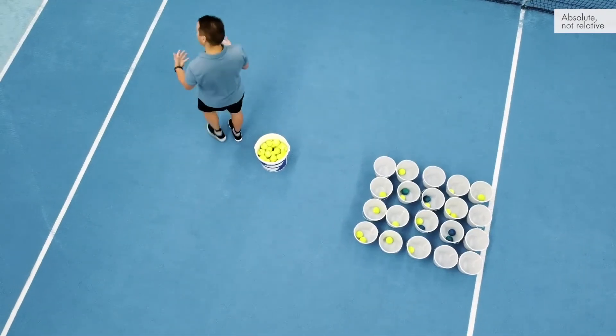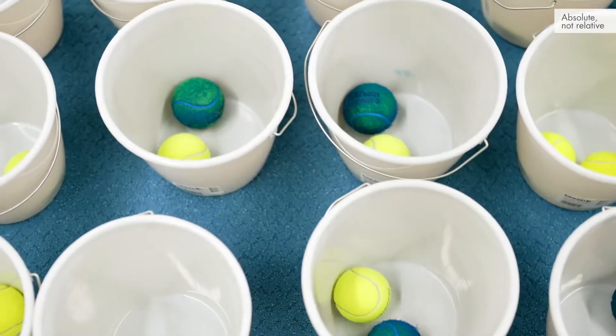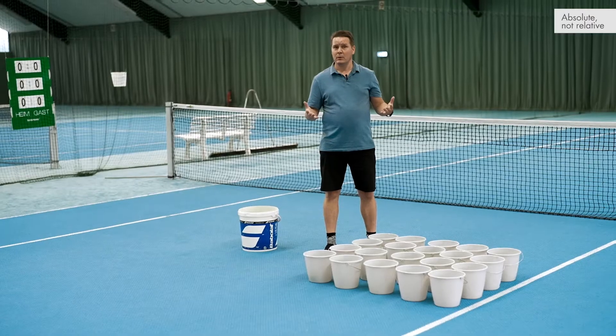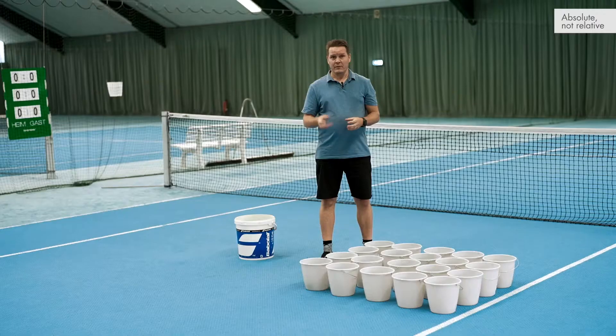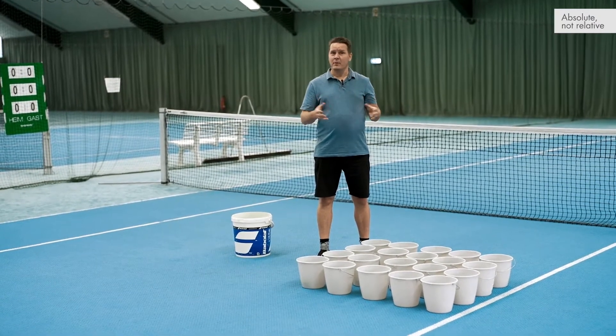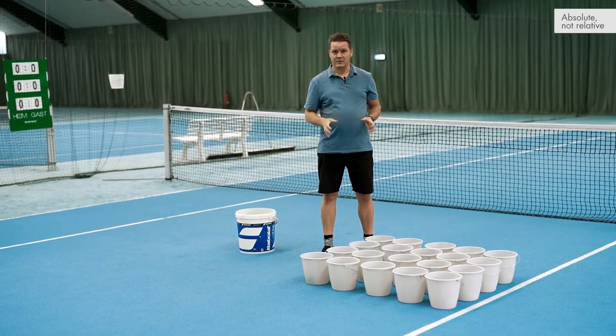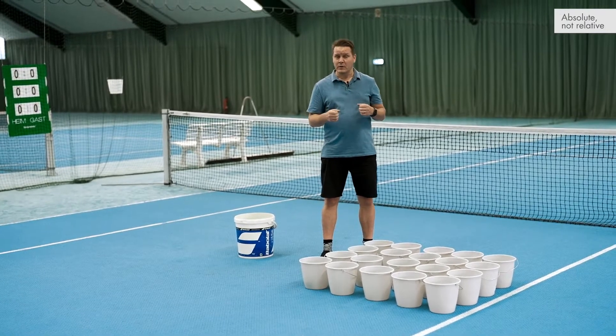In a bulk reaction it's completely covered, so it's impossible to find the target. We have thrown 20 tennis balls into 20 buckets. Is every bucket filled with a tennis ball? No, they are not. Because of random distribution, the blue tennis ball and the yellow tennis ball will end up randomly in these partitions — and our nano plates work the same way.